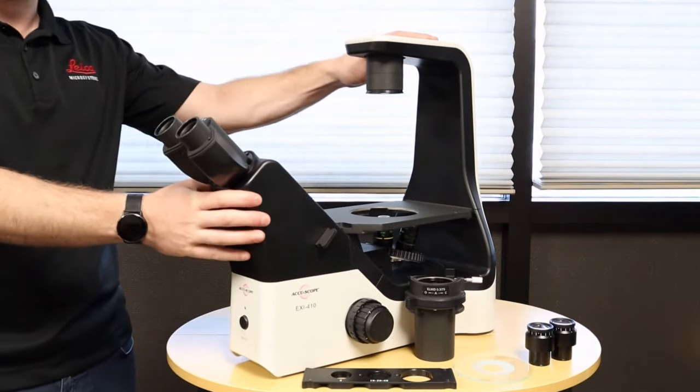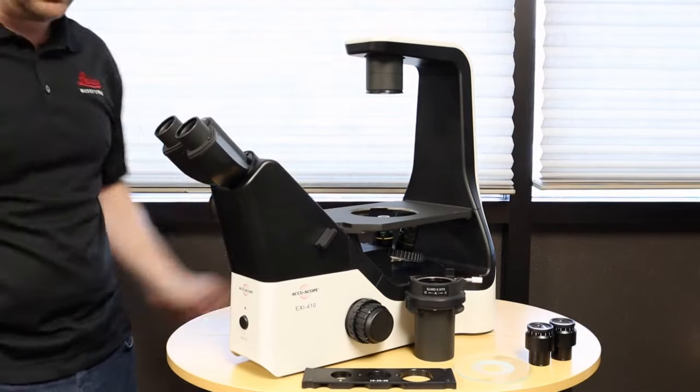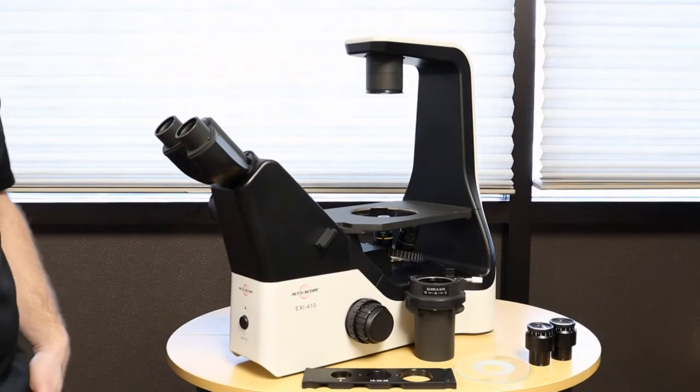Everything as you see on the stand is how it came out of the box, and the accessories that you see here are the components that we will add to the microscope.